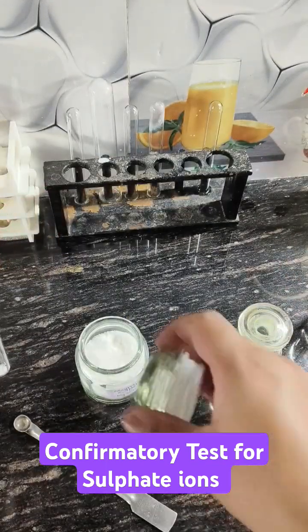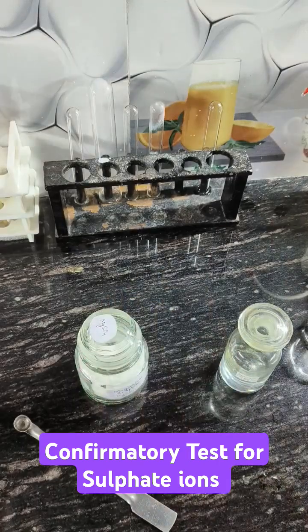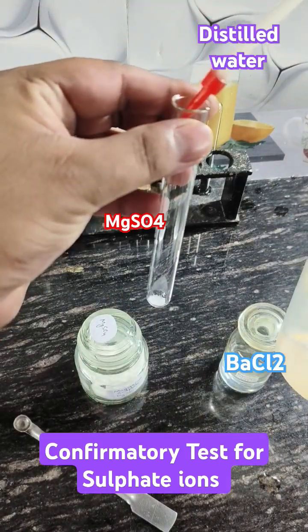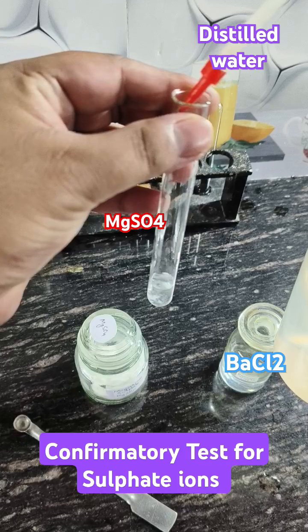To confirm the sulphate ion, I will add barium chloride to this original solution, and that will produce white precipitates.